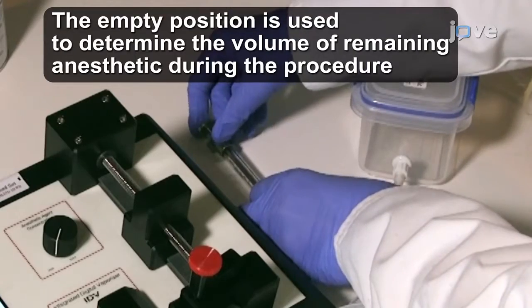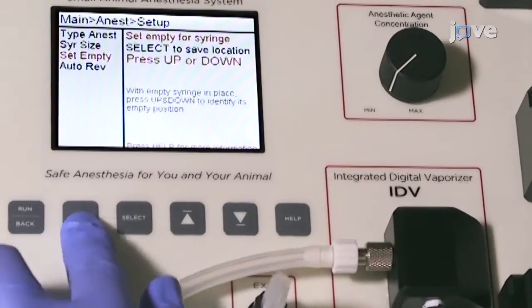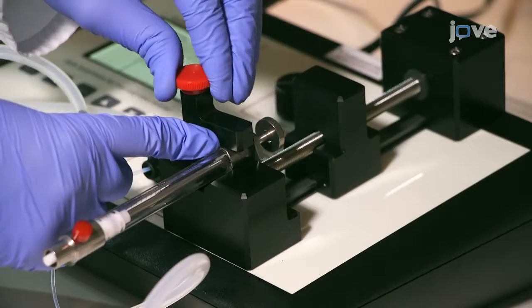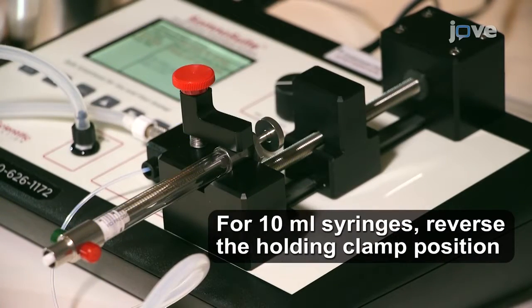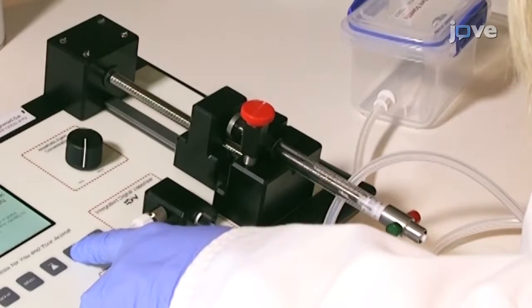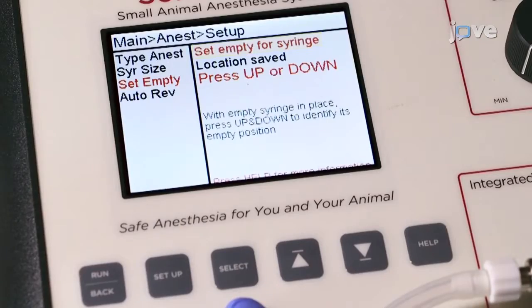After selecting the syringe size, set the empty position of the syringe. Now, secure the empty, fully depressed glass syringe in the syringe retention block. Place the syringe so that the holding clamp is seated on the metal collar of the syringe. Adjust the pusher block so that it makes light contact with the top of the syringe plunger. Save the empty position.